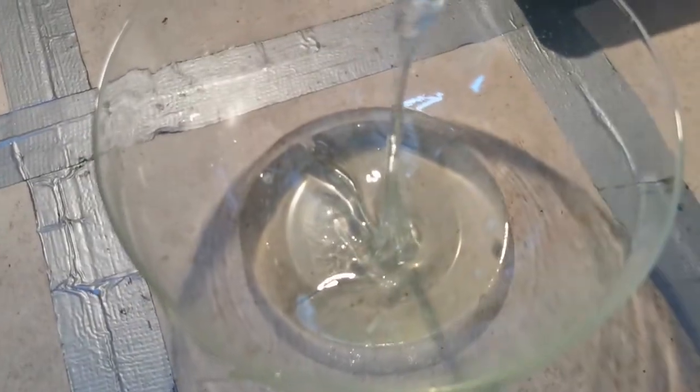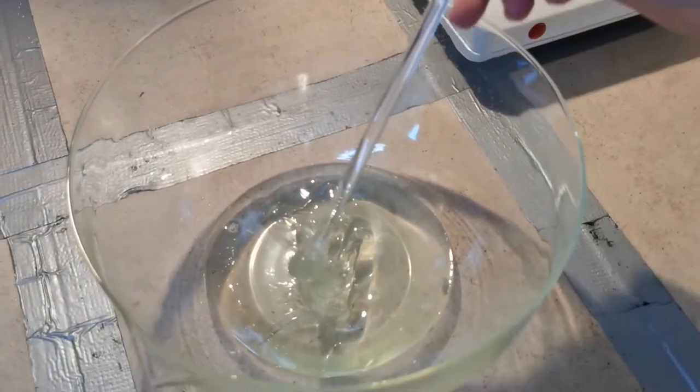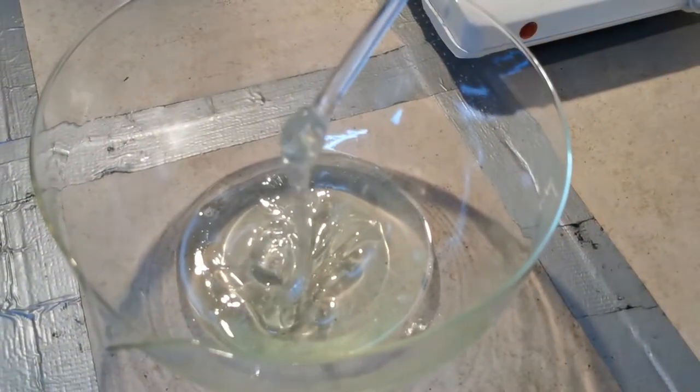Yeah, that didn't happen. I first tried to precipitate the dihydrate by boiling it down until it reached about 110 degrees. At which point it will start to decompose into the anhydride.